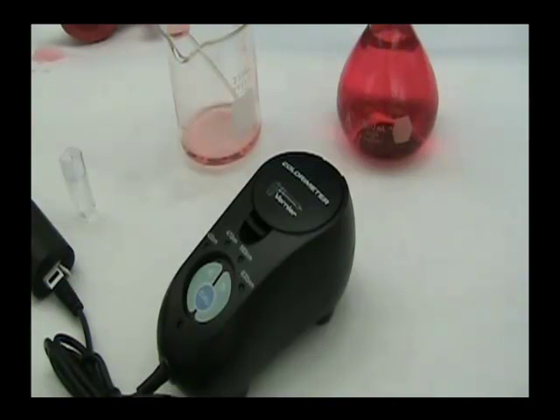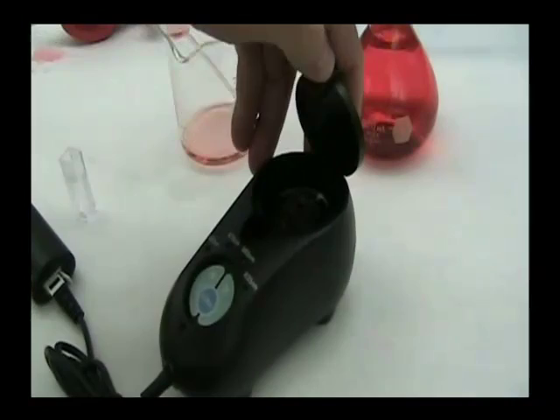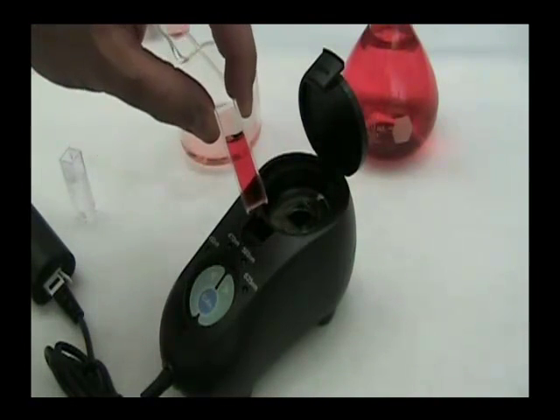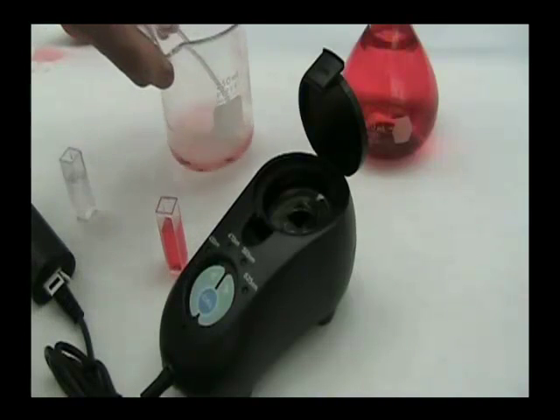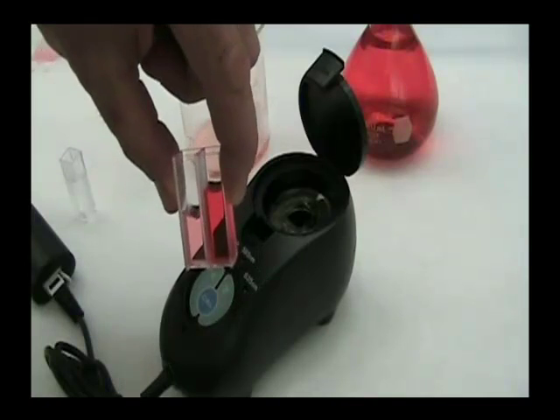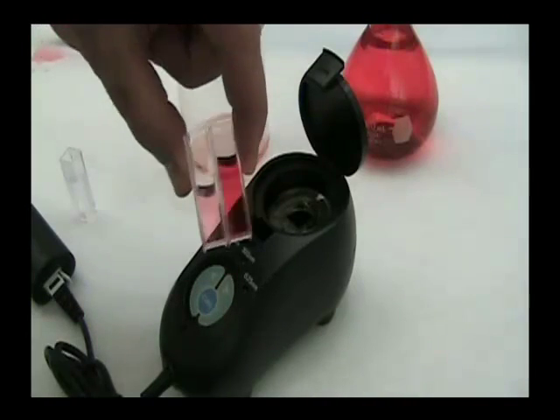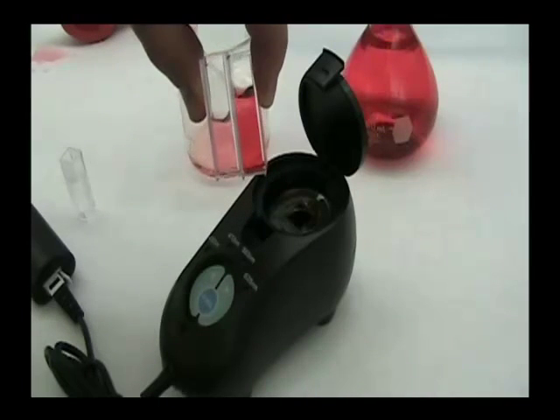There are other details of running that software, but that's for another video. Based on the absorbency of a sample in the colorimeter, we can tell something about its concentration if we are using this same system of colored chemicals. We can compare the concentration of one chemical with another — for example, this sample in this beaker. If we place these two side by side, they obviously are not the same concentration, and we can determine their concentration by shining light through them and measuring how much light is absorbed. The lower the concentration, the less light will be absorbed.